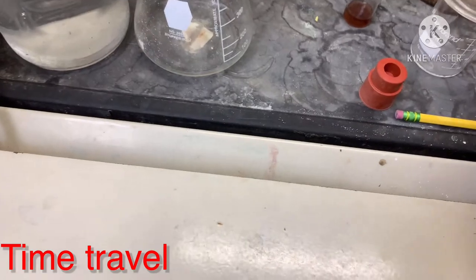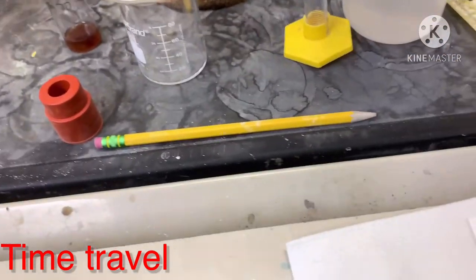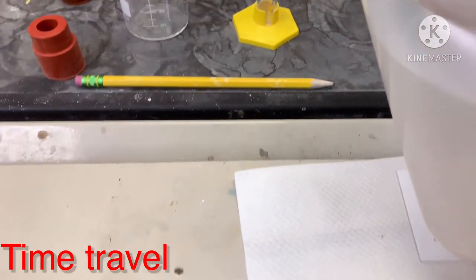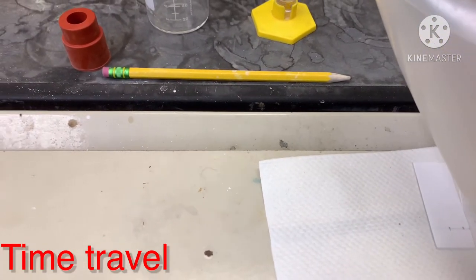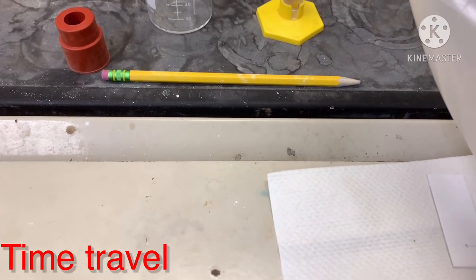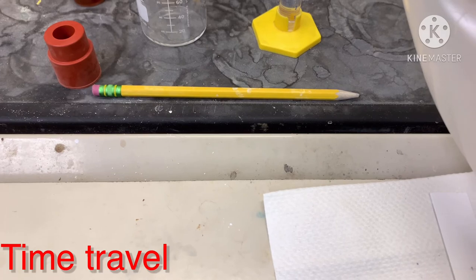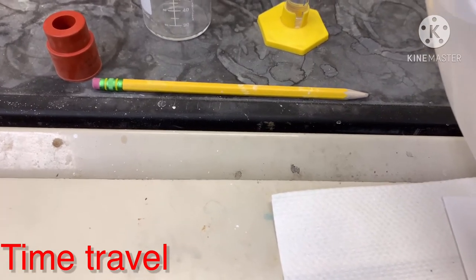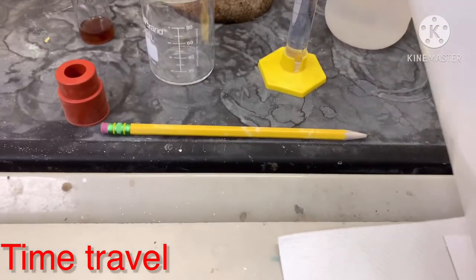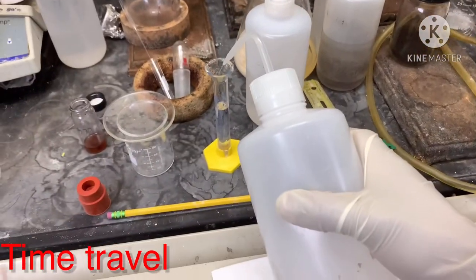I will measure 10 mL of solvent for this run. Since I know the compound is very polar, I will use DCM with 4% acetone — that is 96% DCM and 4% acetone — for a total volume of 10 mL.